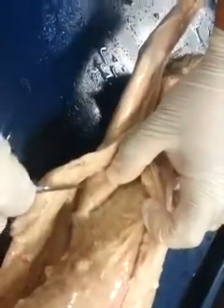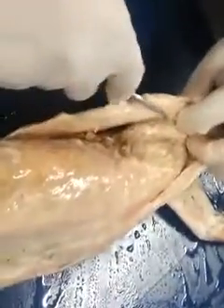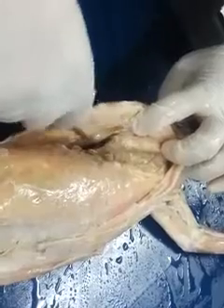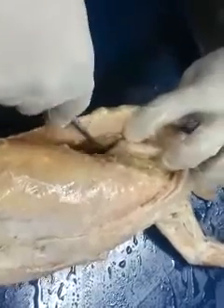The infraspinatus, okay, where the probe is pointing to. Okay. And then if you kind of hold this guy sideways like this, where the infraspinatus is, right at this border, you actually have the teres major and the rhomboideus major going up towards the back. So infraspinatus, teres major, rhomboideus major.